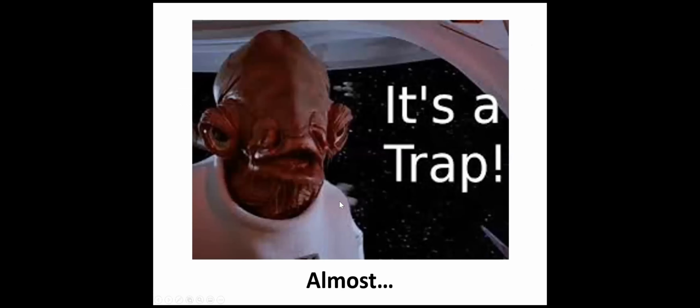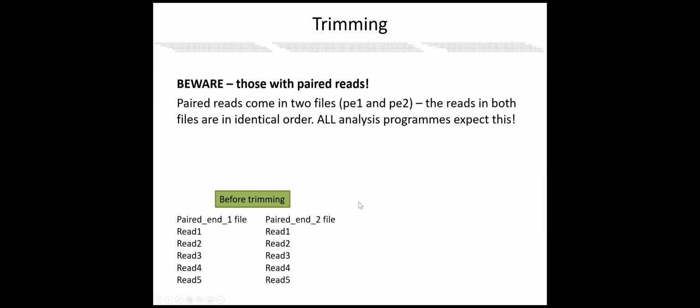But there's a little bit of a trap here to be careful of. The way paired end reads tend to work is you have paired end file 1 and paired end file 2, and most programs are going to take one read from each file at the same time. Read 1 from paired end 1 and read 1 from paired end 2 are going to be consumed by the program. It's going to do whatever it does. Then it'll pull the next set of reads, and it should be read 2 and read 2. Pretty much every program on Earth expects this.